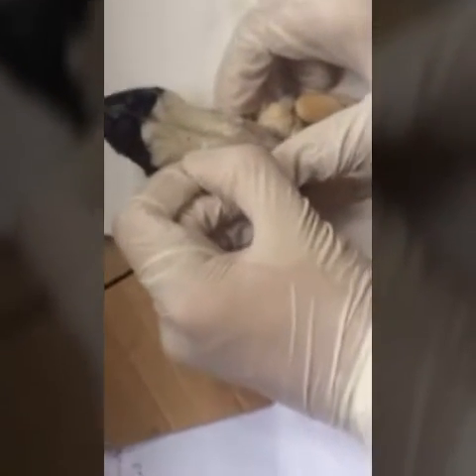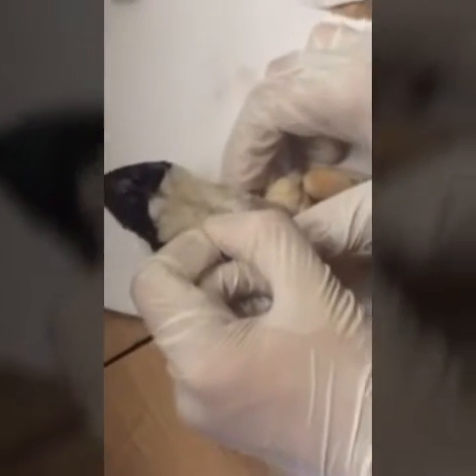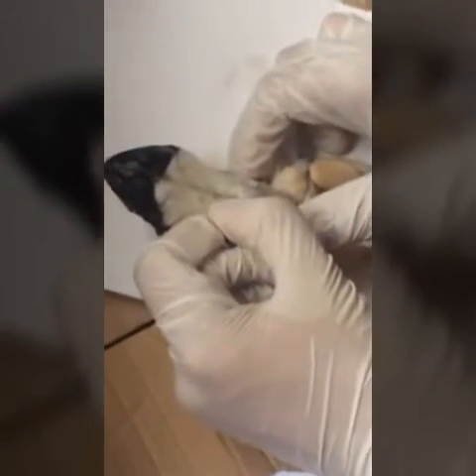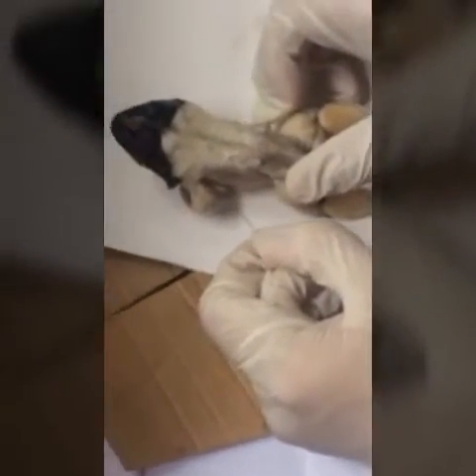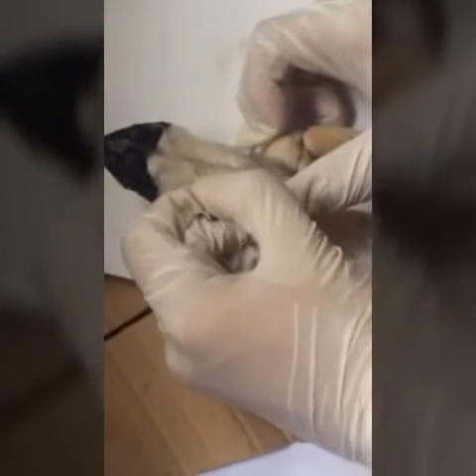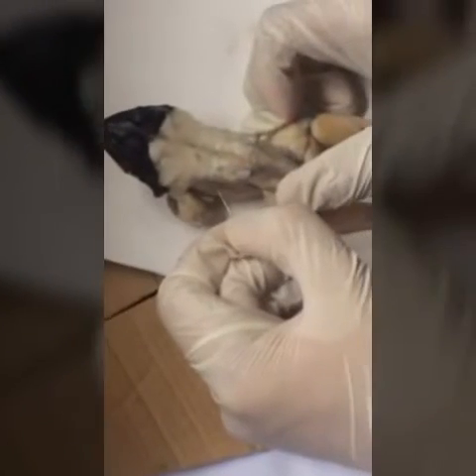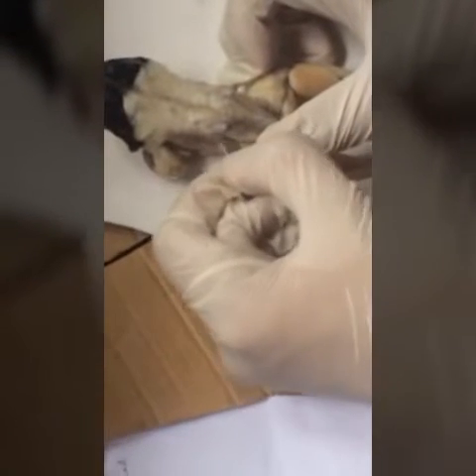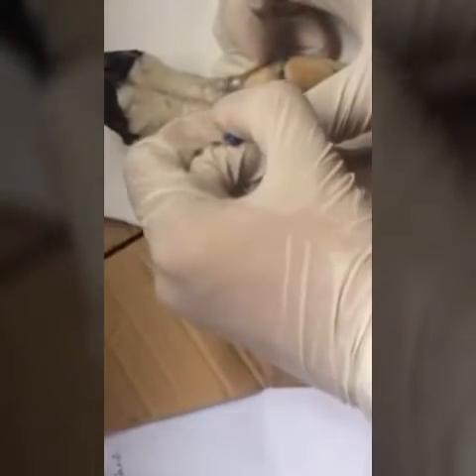Then the latissimus dorsi over here. Then the external oblique, the one at either sides of the edge of the frog. Then you can see the longissimus dorsi right over here. Then iliolumbaris here, the lines over here. And you can see the coccygeo sacralis over here, near the hump.